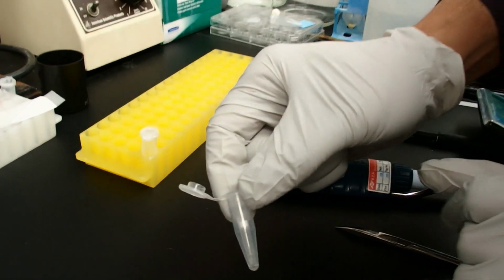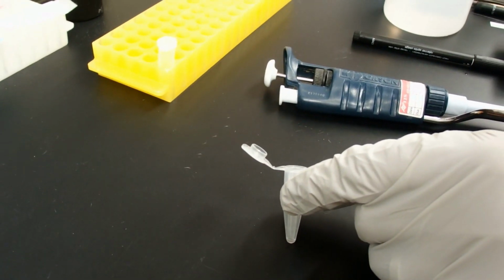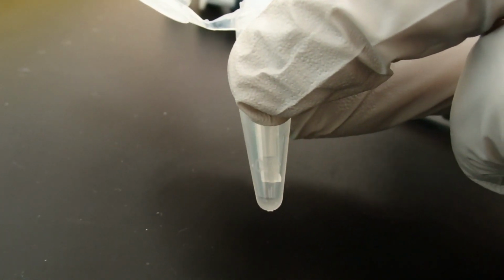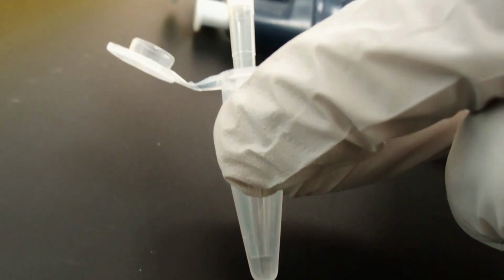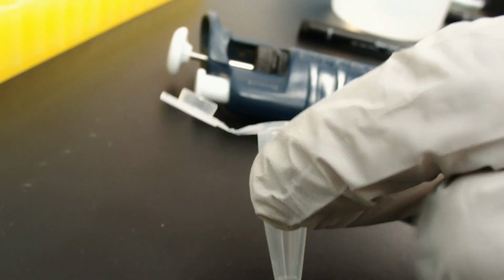And for the P200 tip, we have to use the P200. Get that out. And what you're going to want to do is, you see there's a lot of the DNA and liquid in the tip. So you're going to want to blow that out. And hopefully this time we got most everything, just a little bit of a droplet on the outside of that tip. Not going to worry about that. Can you put the two tubes here to see?